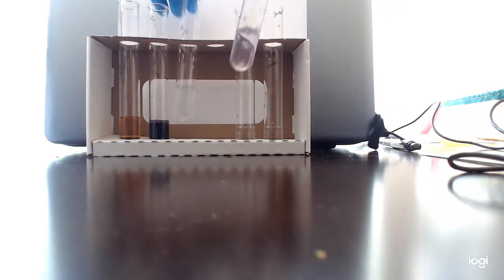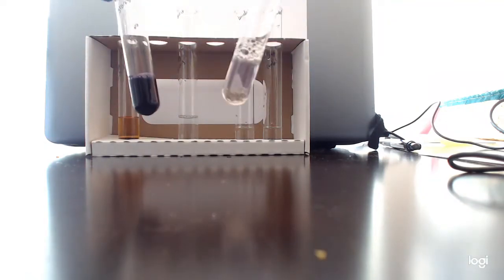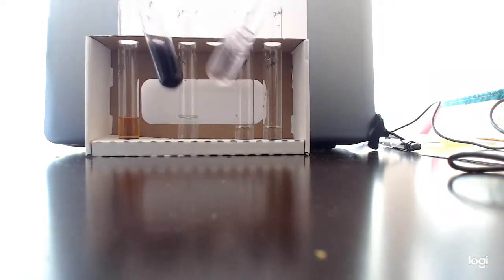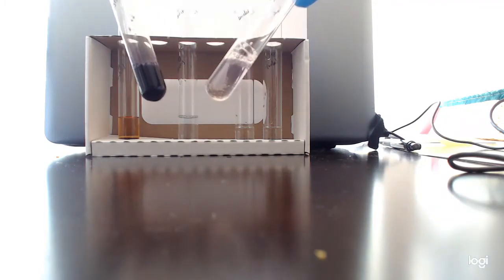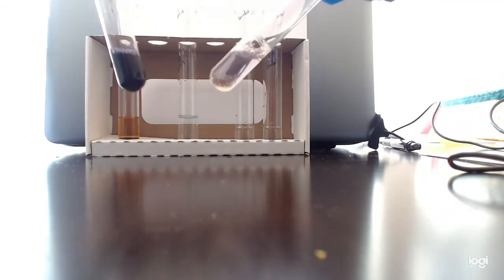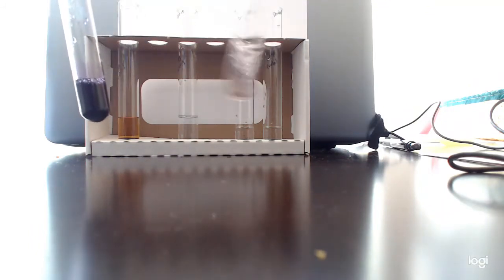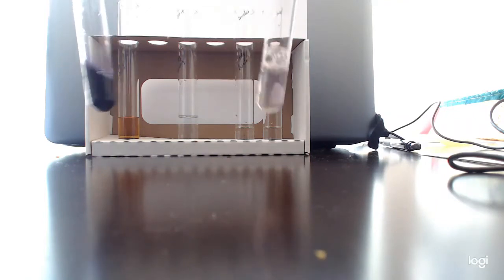Now note, please, that both of these, starch positive control and protein positive control, are both purple, but they're different qualities of purple. So like on a test, hint, hint, on a quiz, hint, hint, if you are saying purple, you need to tell me if it's dark purple like starch or light purple like protein. Otherwise, I won't know which one you're talking about.